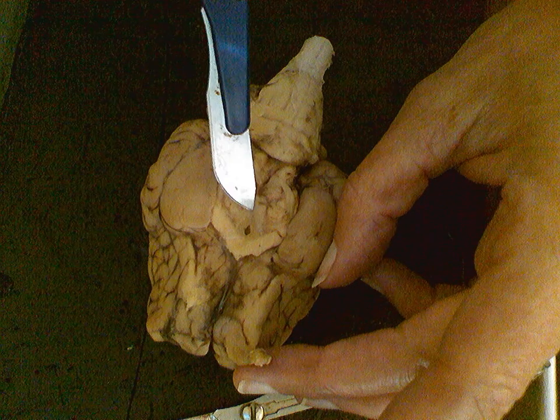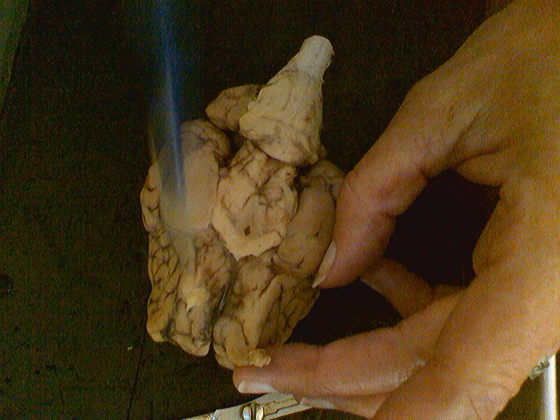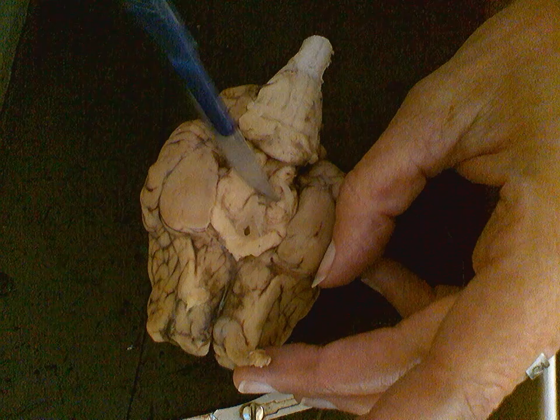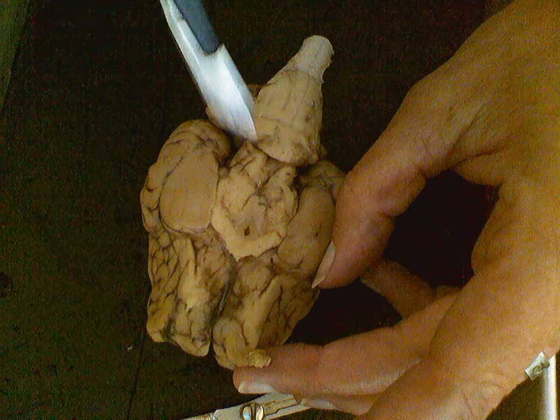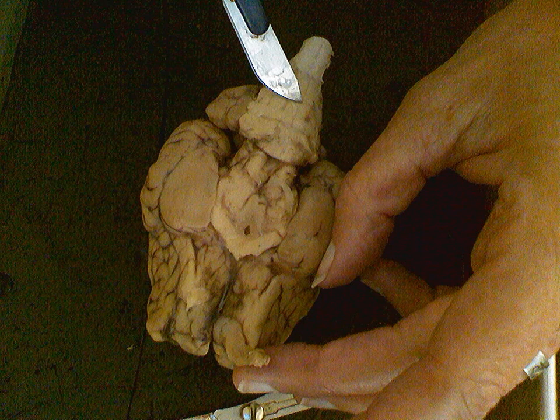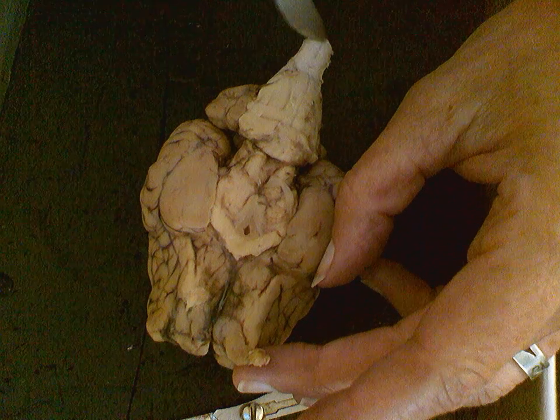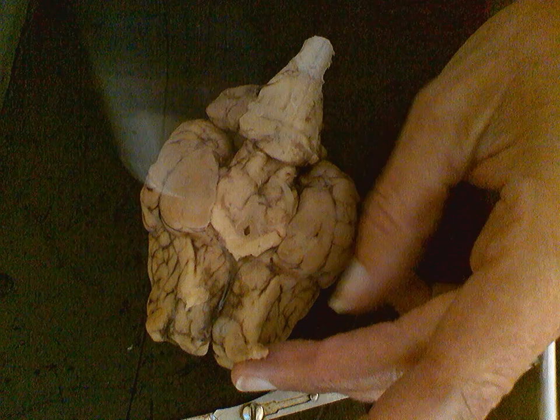This part in here, we're looking at this as being the forebrain. Here we are in sort of the midbrain region. And then behind that, we call this the hindbrain, which in our view we can see this kind of pouched out area a little bit extended, which is the pons. On down, we see something that's a little longer and a little thinner. That's the medulla, or the medulla oblongata. And then finally down into the spinal cord. We can also see parts here of the temporal lobes on both sides from the basal view of this brain.